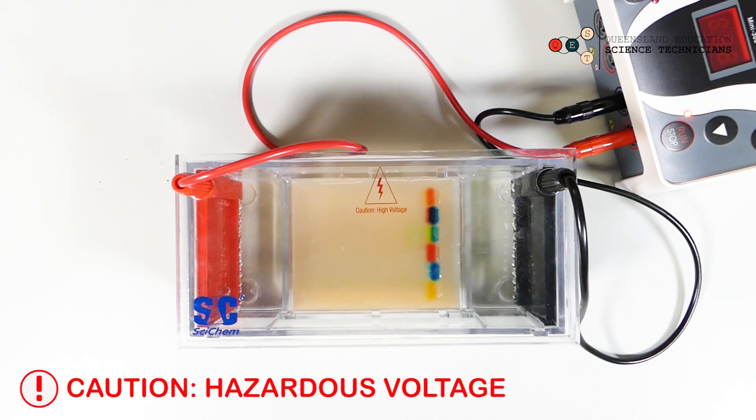I'm going to stop it there. You can see that the process is working, that the dye is moving through the gel. And I want to stop the process now, so I'll press stop. Be very careful not to touch anything until the power pack is turned off and disconnected from the wall. Safety first.